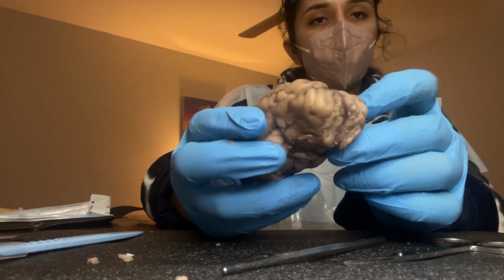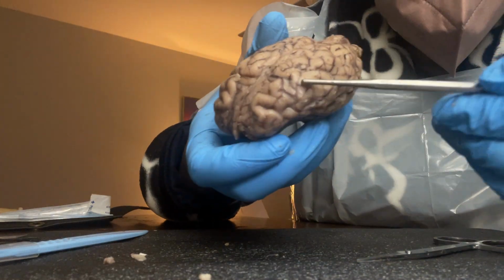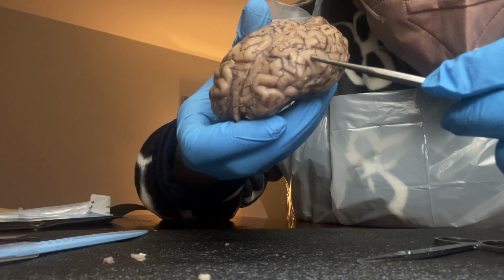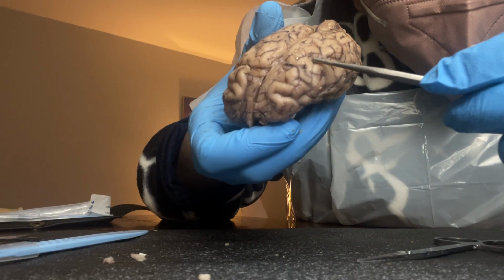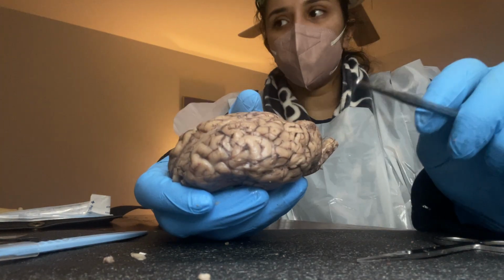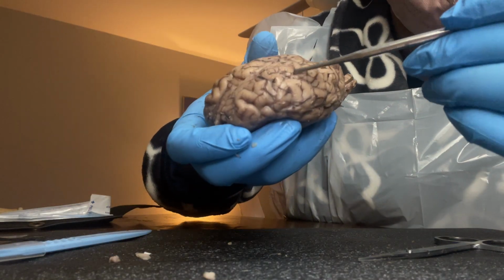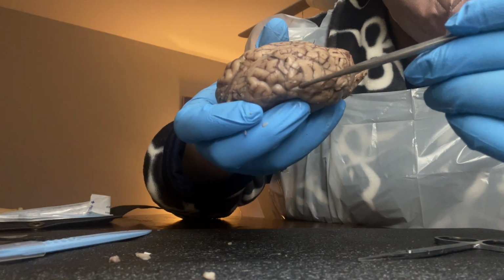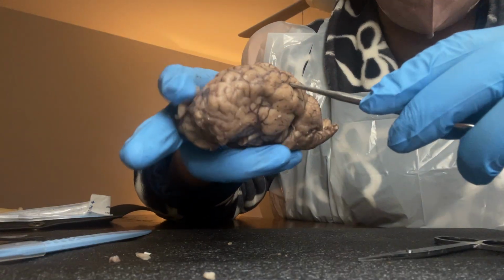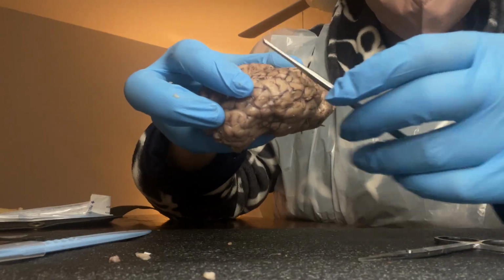And then the next one we have is the gyrus. If you can see right here, this right here is the gyrus, and those lines that you see going through are the sulcus. And then we have what's called a central sulcus. The central sulcus basically starts from here, right there, and then the lateral sulcus, my bad, is about right here.